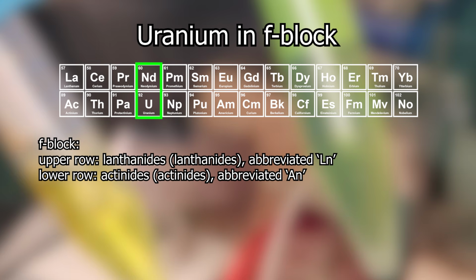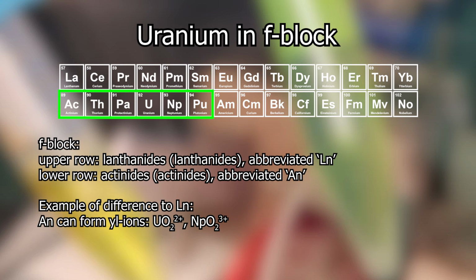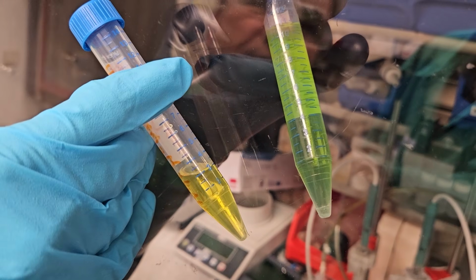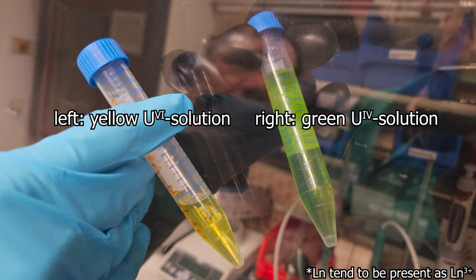Well, it's more of a coincidence that it fits so well because the early actinides in particular, i.e. the first ones, are chemically a bit different from their respective lanthanide analogues. So we looked at a neodymium 3+ solution, and here we have a solution of uranium 6+ and uranium 4+. Uranium 3+ is a bit more unstable than the other oxidation states.